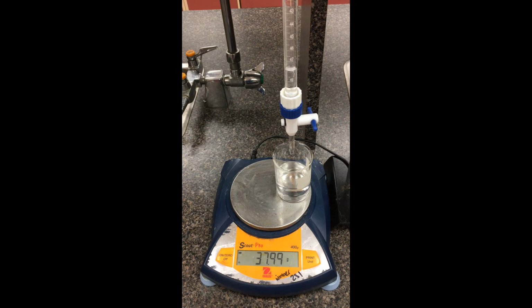Okay. So what you're going to do is you're going to take down this data here. You're going to be putting mass on the vertical axis, volume on the horizontal. Plot all three data sets, the water, the salt solution, the methanol solution, on the same graph. You can use different markings. You can use different colors. Try to draw a best fit line, and by calculating the slope, you should be able to find the densities of these solutions. Thanks, guys.